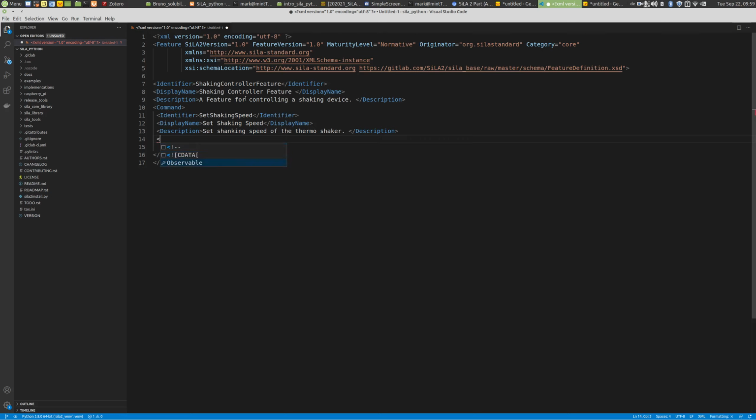So okay, next would be the discrimination of whether this command is observable or not observable. And here you have the choices between yes and no. We say no. If you say yes, then you could monitor a certain behavior over time and get updates of the values. So for example, if you would like to monitor the temperature over a certain time interval or over a longer time, you could make this observable. But for setting the shaking speed, this is not necessary. Okay, so we don't want an observable command.